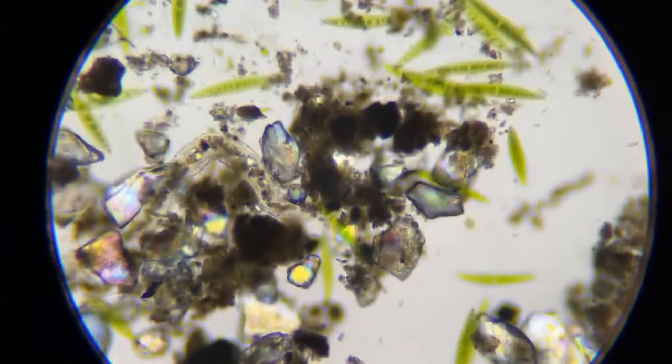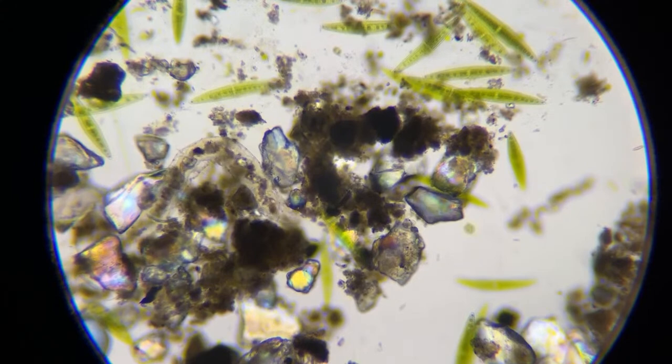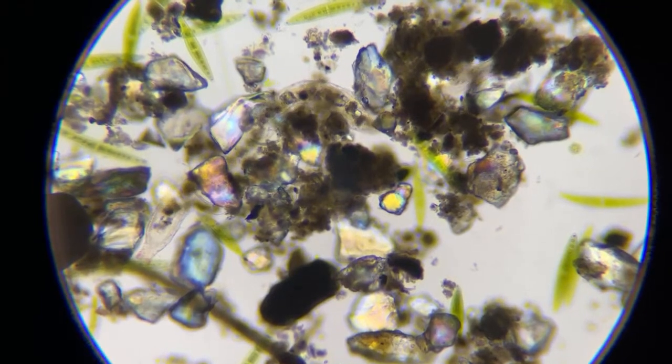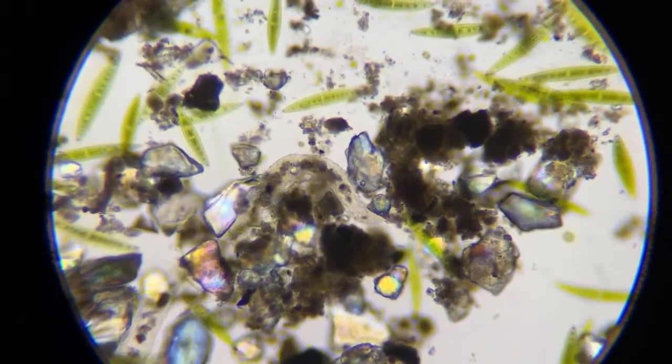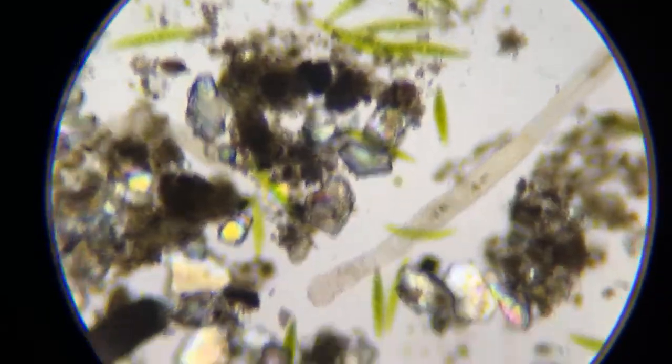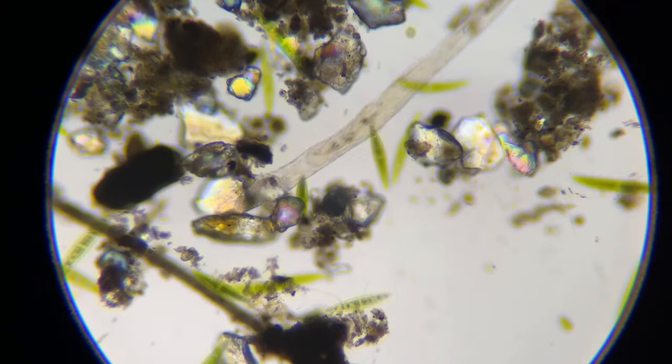But just so you know, everybody watching, this is 1 drop of pond water, okay? 1 drop. I'm not even at a pond, this is puddle water. Here comes my buddy.